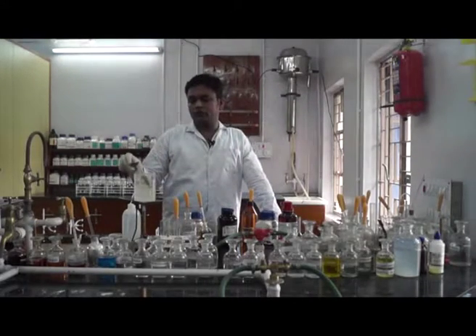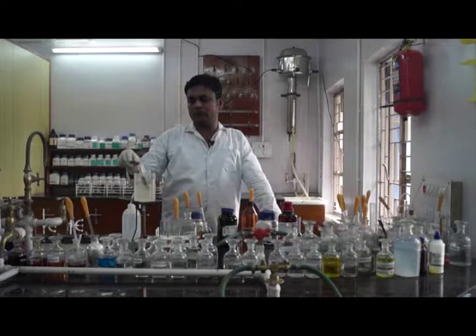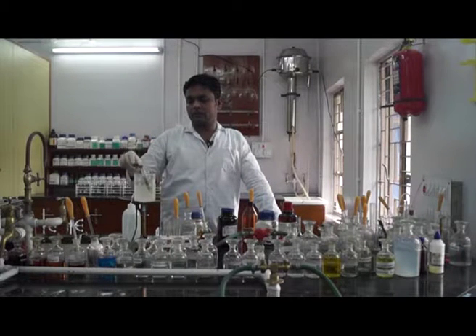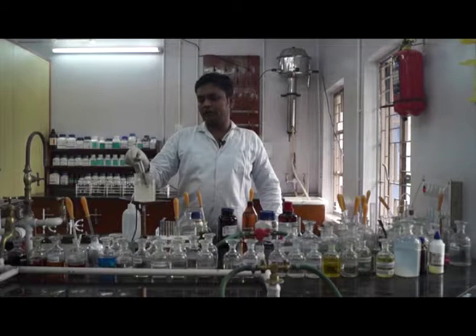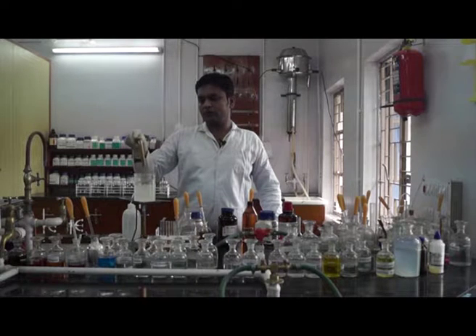The nitro group is reduced to a hydroxylamine group and it will give us the positive result. It must be noted that the solution must not bump, so heat it gently and carefully.